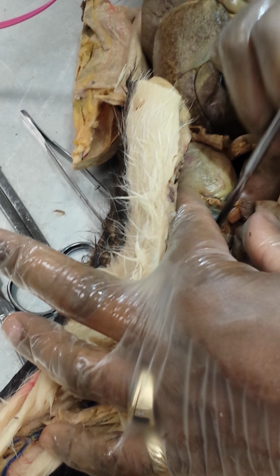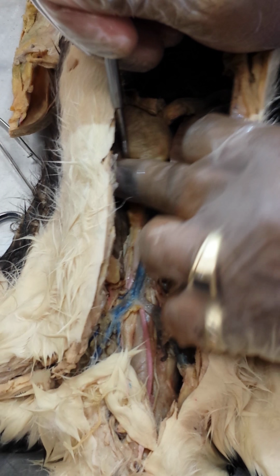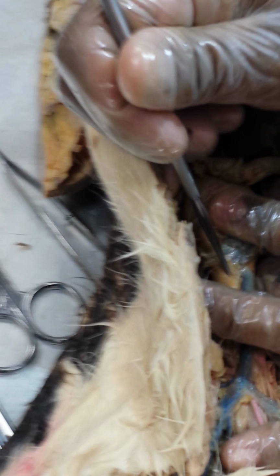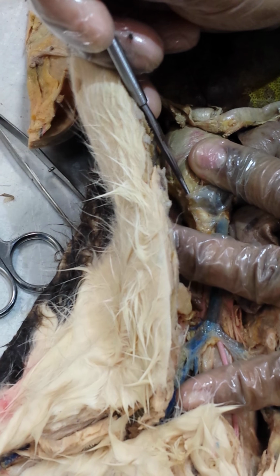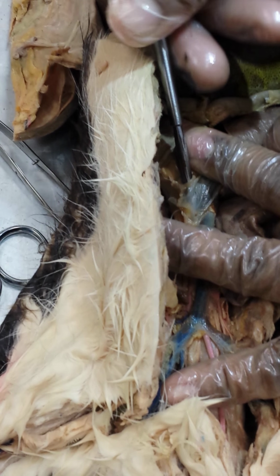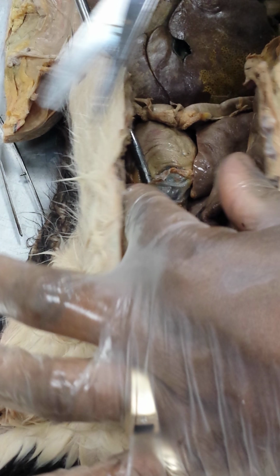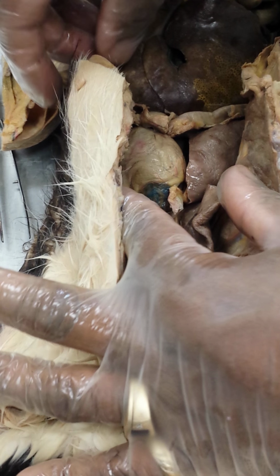And if we go back to the heart, find the aortic arch or the ascending aorta, which may sometimes be difficult, but if we have pericardium here still intact, let's see if I can cultivate a little bit more of it. Open it up some.